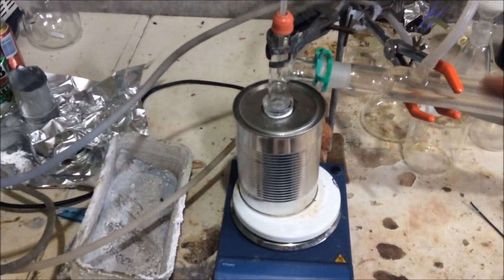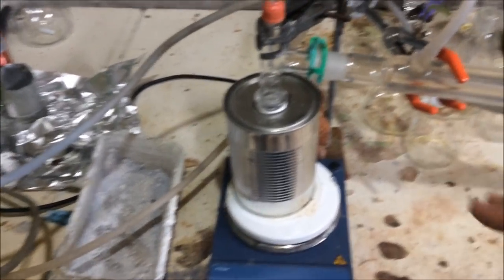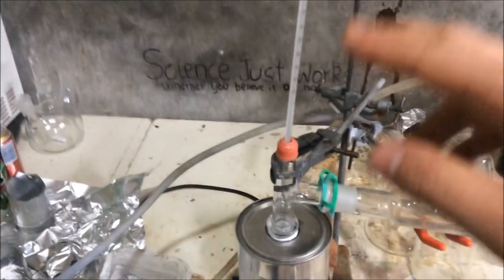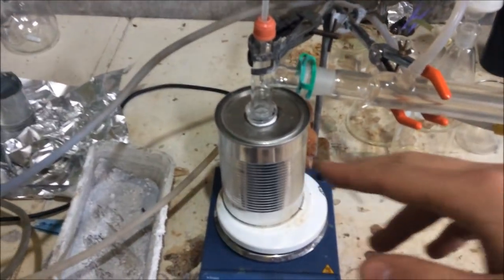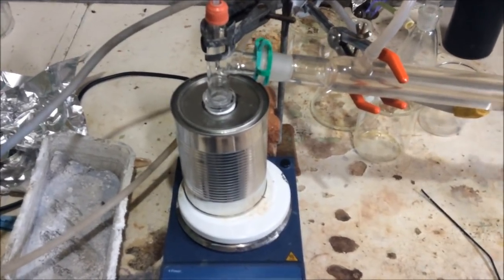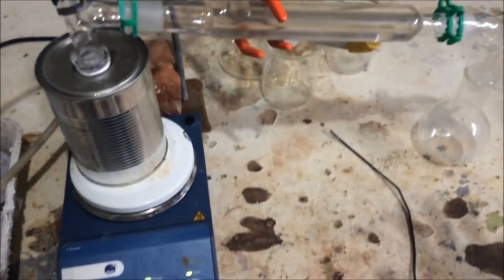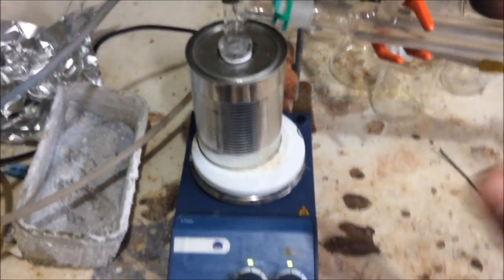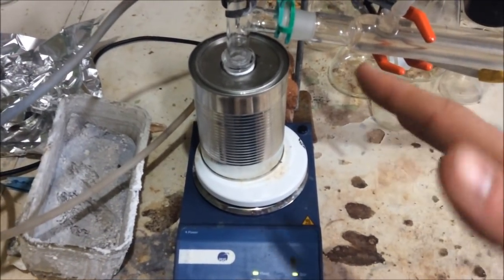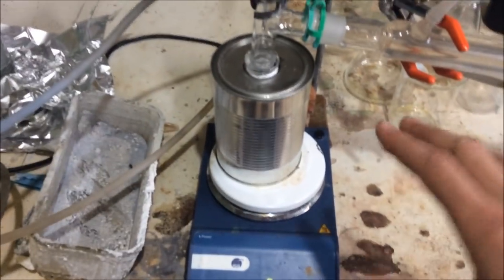Now, the big issue, the big sort of variable that I have about today is that the ethylene glycol will distill over at 198 to 200 degrees or so. Sodium hydroxide melts at about 220 degrees. Now, we obviously don't want any benzene in our ethylene glycol. We don't want any ethylene glycol in our benzene. So hitting that, we've only got 20 degrees. It really should be separate events.